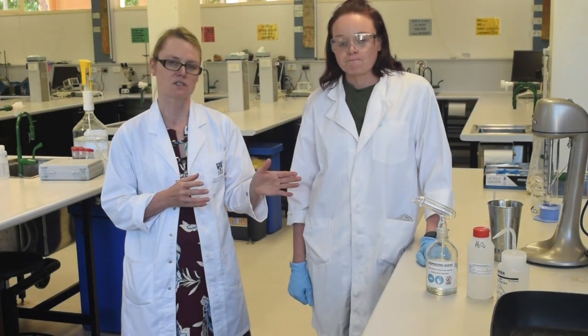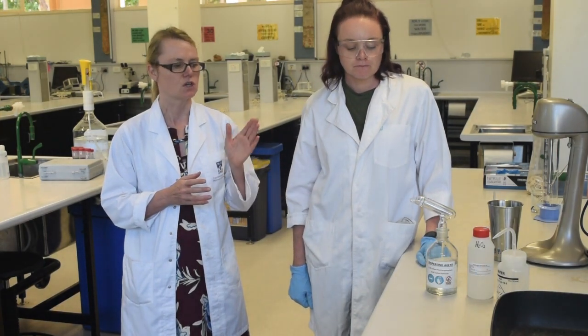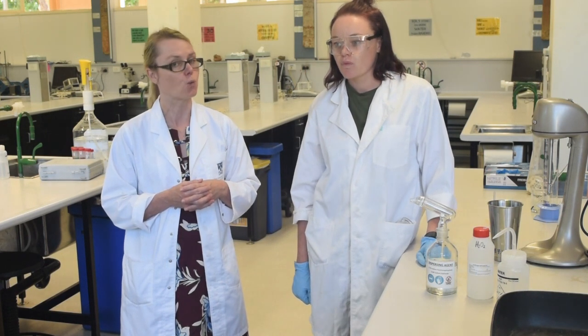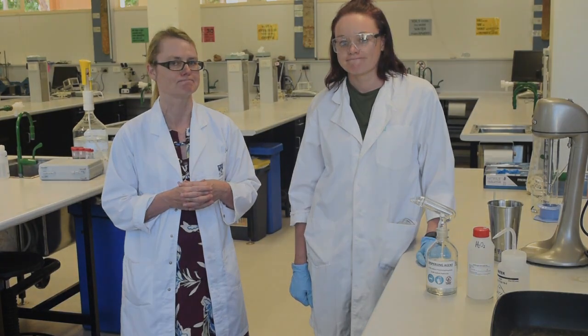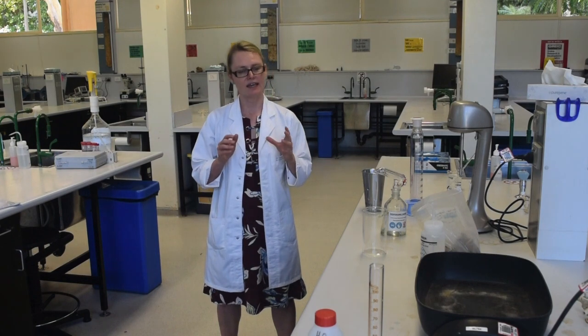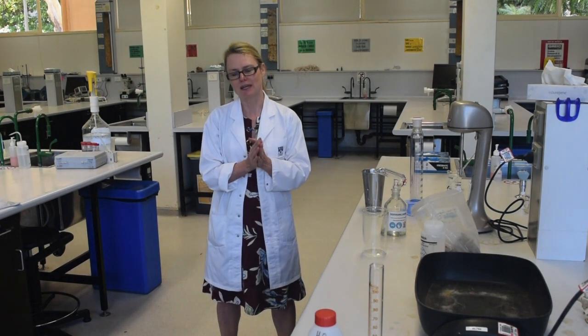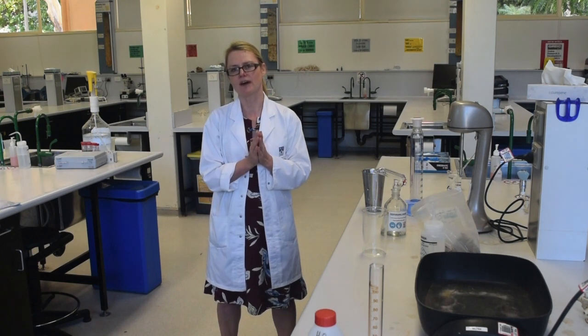As mentioned, when you come to dispensing the dispersing agent you may not have used that particular type of equipment before, so wait and ask your demonstrator to show you exactly how to use it. Those are the key elements to this lab. This video isn't a substitute for reading your lab manual, so please spend 30 minutes reviewing what's required and ask your lab demonstrator if you have any questions. Enjoy the practical!